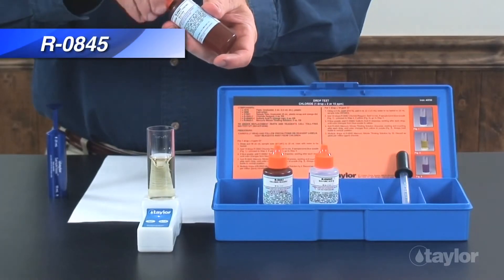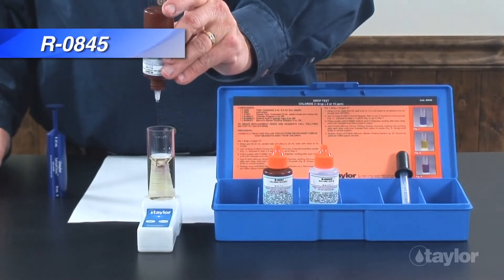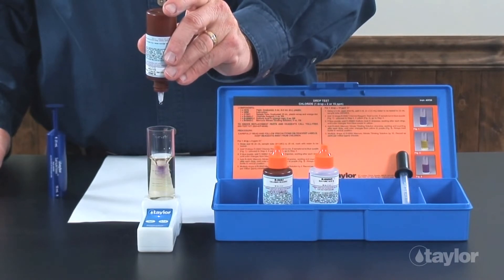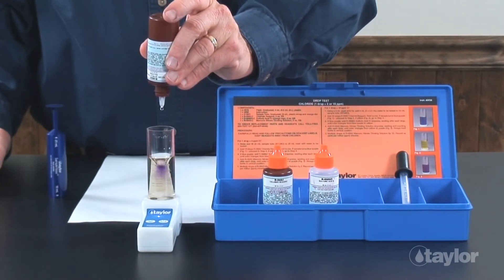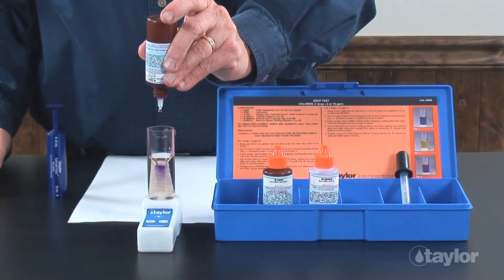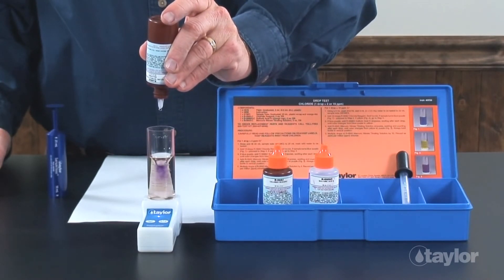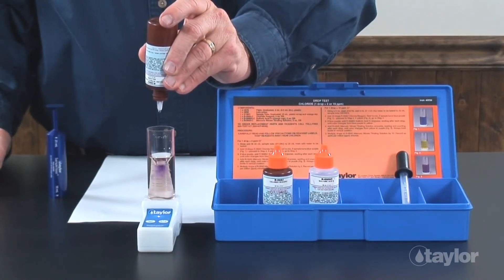Next, add reagent 845, mercuric nitrate titrating solution, drop-wise, swirling and counting after each drop until the color changes from yellow to purple.